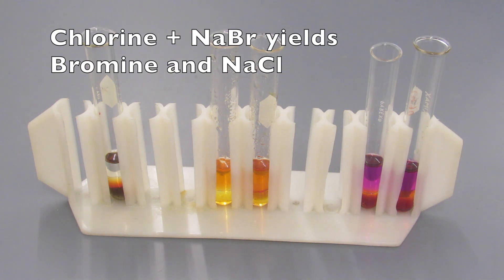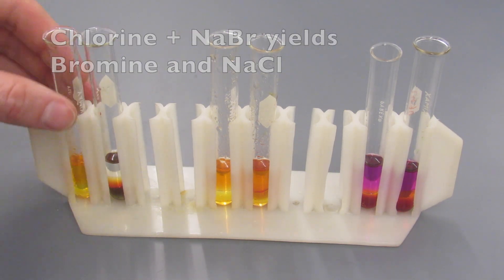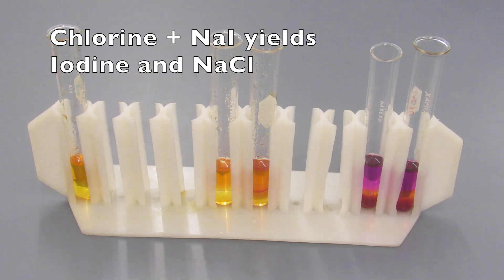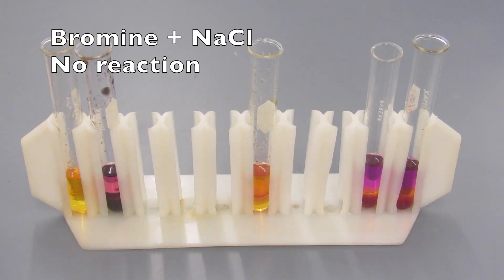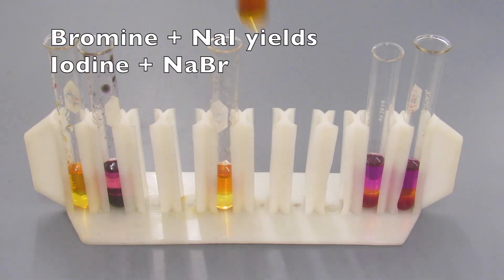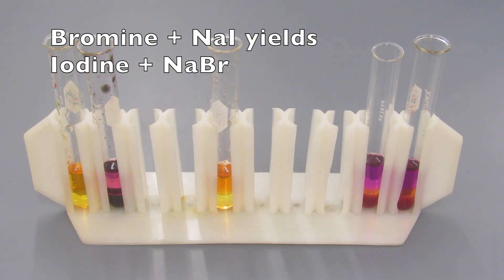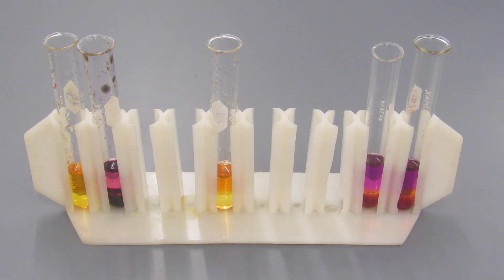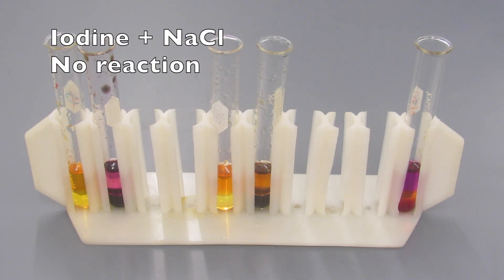So now we're going to mix up the tubes to get everything reacted and mixed together. We can now see an orange layer on top of the first chlorine tube, which indicates that we have Br2 that has formed. The second tube we can see the purple color, which tells us we have iodine forming in the second chlorine tube. In the third tube we still see bromine on top, so there's no reaction with that third tube.